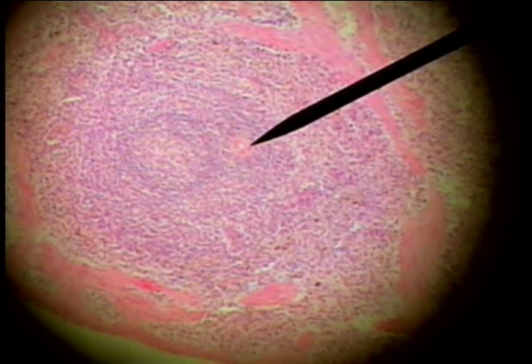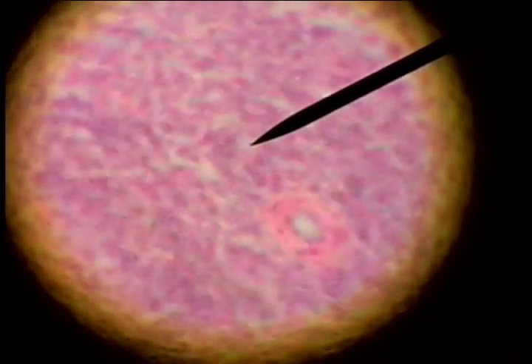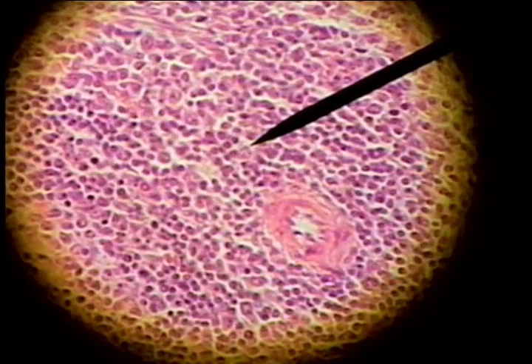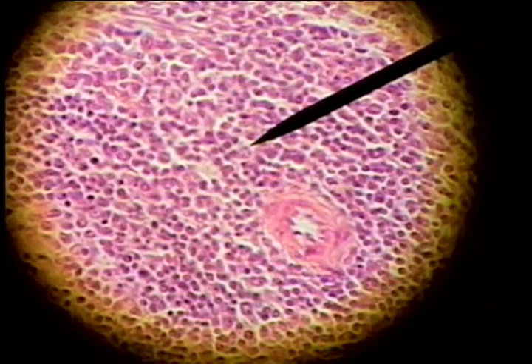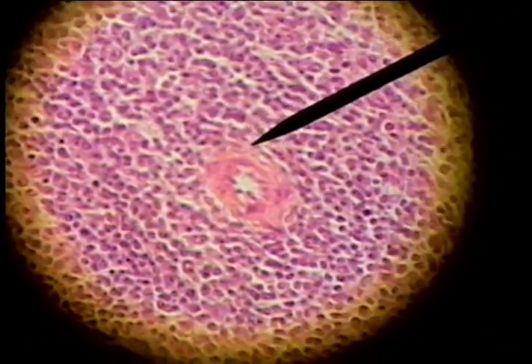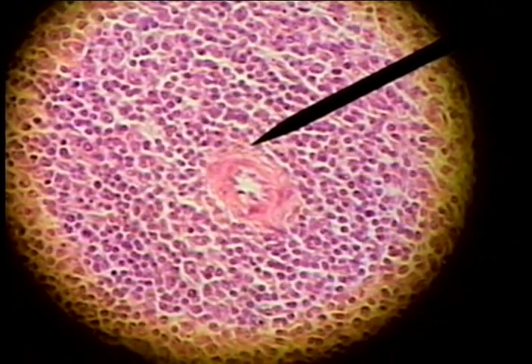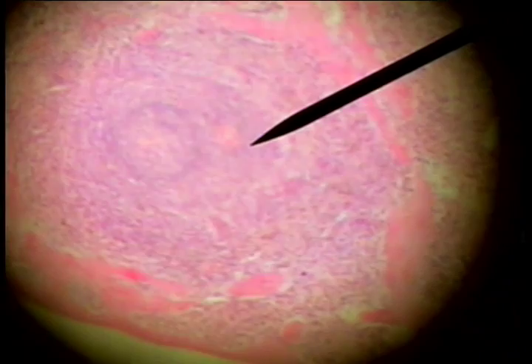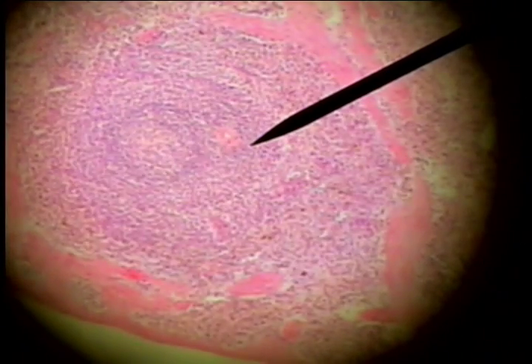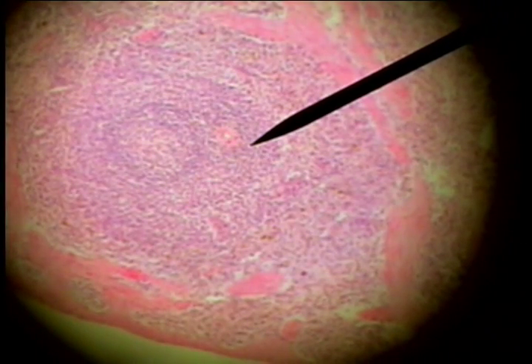There is also a characteristic structure: the central artery of the spleen. Looking again here on higher power, we see the lymphocytes in the lymph nodule and the central artery, which is a key feature for identifying the spleen.